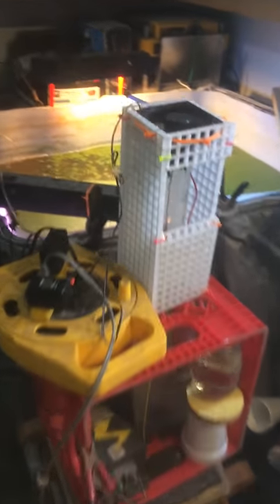This is my nitric acid setup. Up here we have the reactor, as I like to call it, where I have an arc and a little air jet blowing through the arc. And this is my cooling tower with a computer fan.